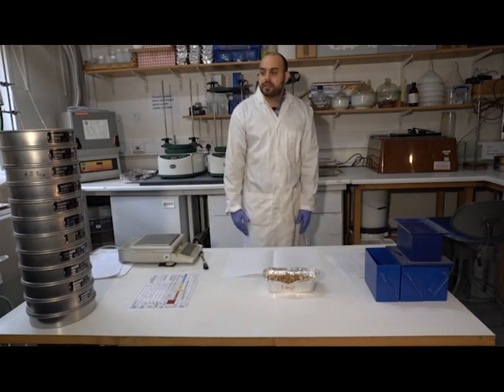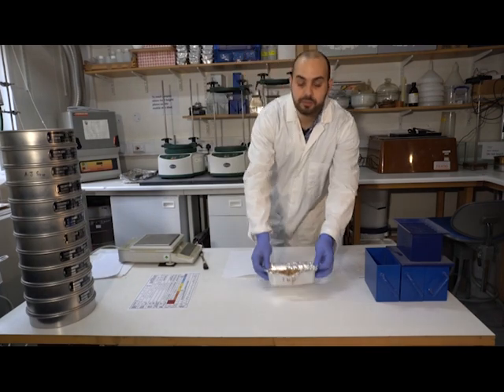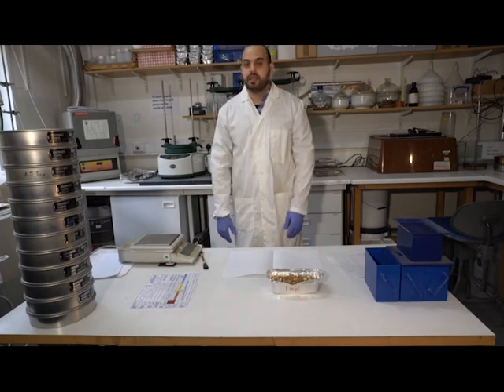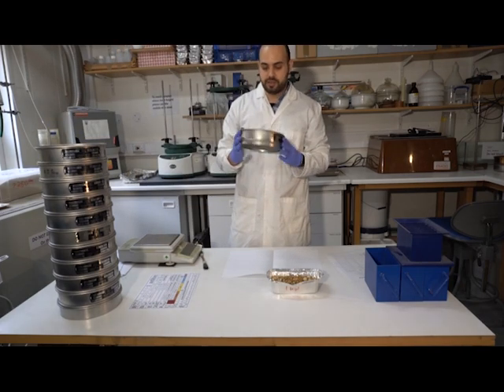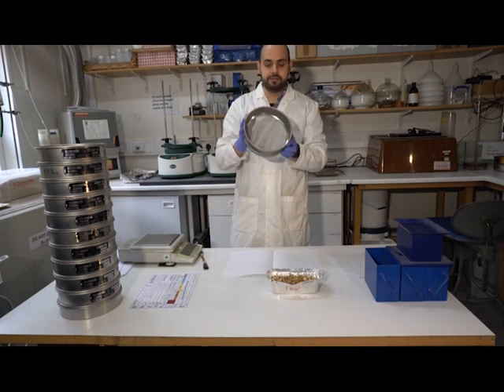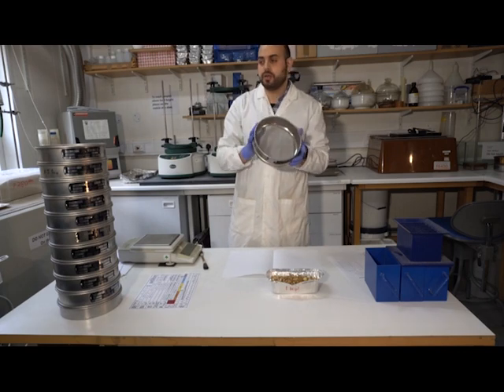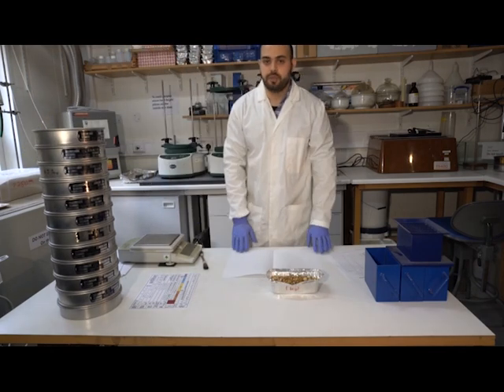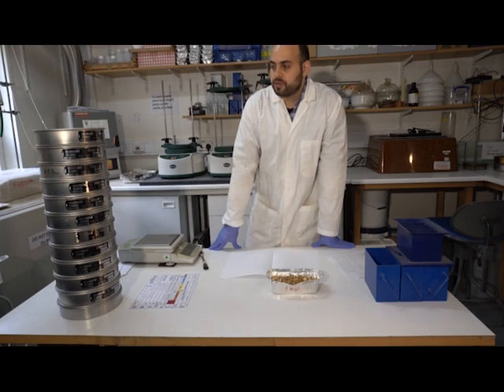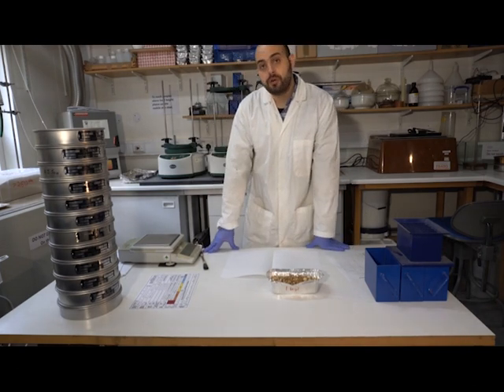Now I want to do dry sieving, and dry sieving is an easy technique that will allow us to divide this sediment sample into different size classes. We do this by constructing a stack of meshes of increasing aperture sizes. This is a standard sieve, and you can see it's constructed out of a mesh with a defined spacing between the wires. They go from larger mesh openings at the top to smaller mesh openings at the bottom. We usually want to do this consistently, so we sieve our sediment or soil in classes that jump by a half phi scale or by a quarter phi scale.